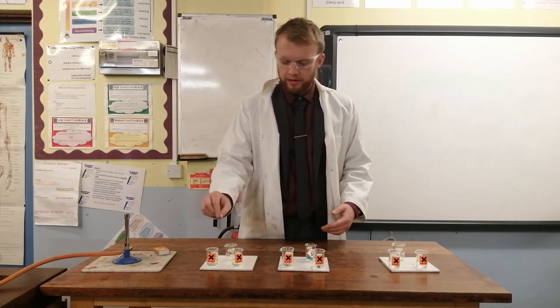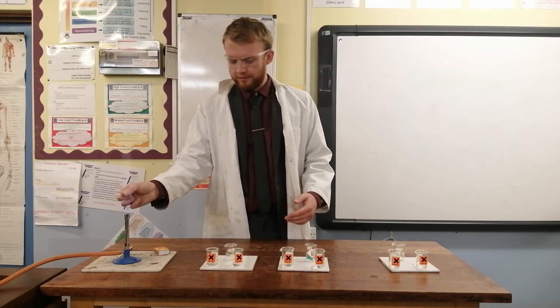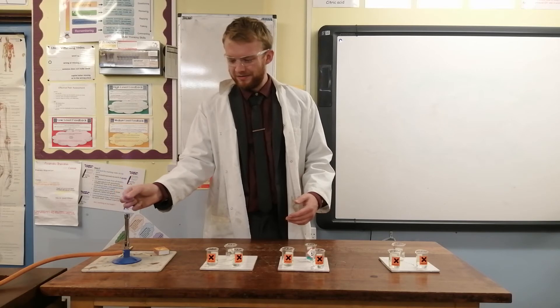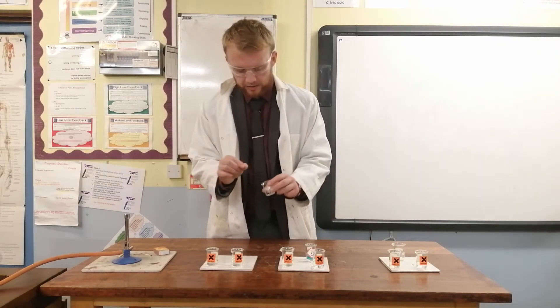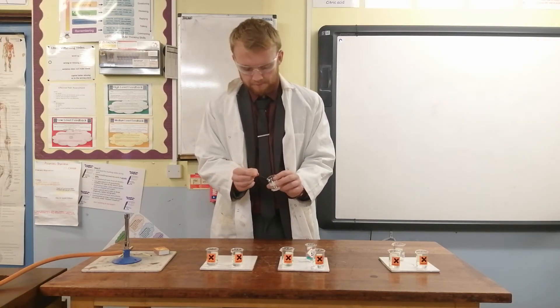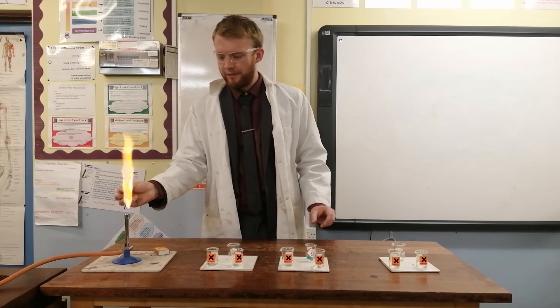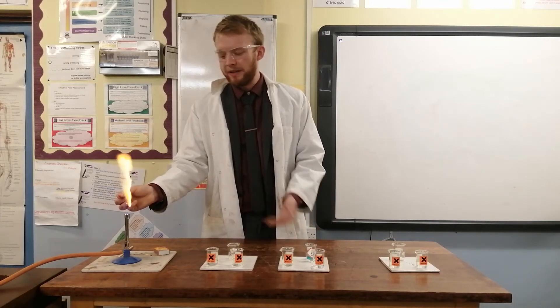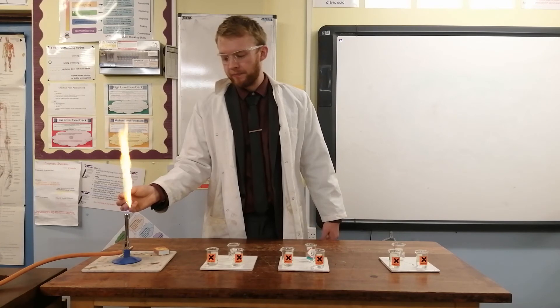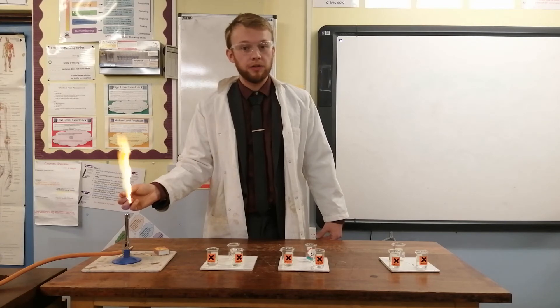Let's move to our third sample, cleaning the separate nichrome wire. Place it into my third sample. And we can see this brilliant yellow flame given off. This tells me that the metal ion must be sodium, or is very likely to be sodium. This is the same colour that you see in old style streetlights because they contain sodium as well.